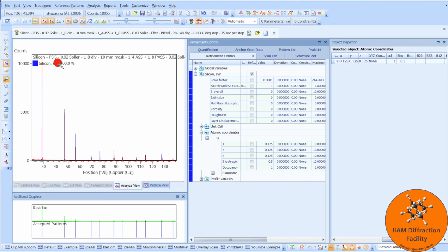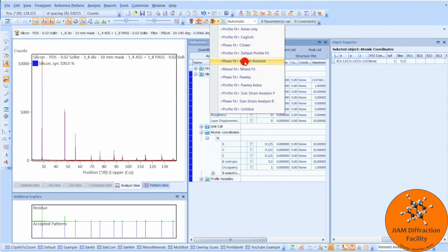But once we have our information entered into this window here, we see it also here, and we now see a percentage here. And if you recall, before we were unable to click this button to refine it, but now we can. So that shows us that our problem is solved.